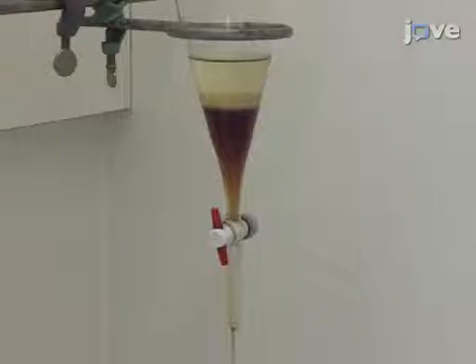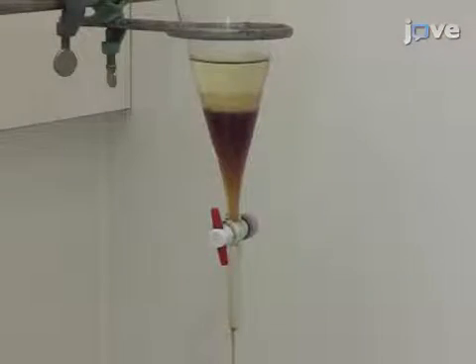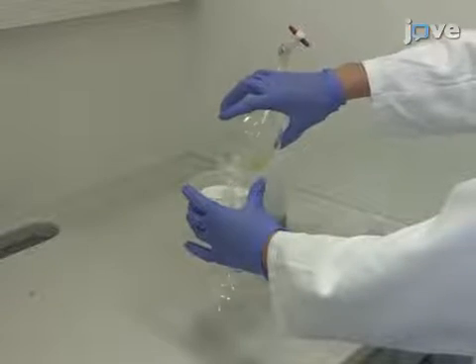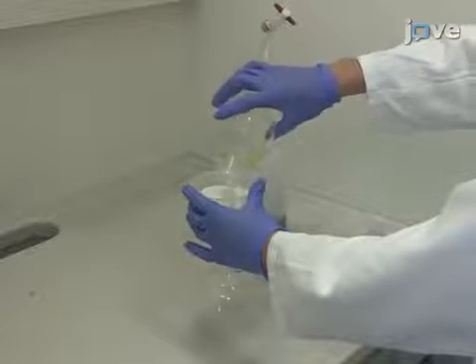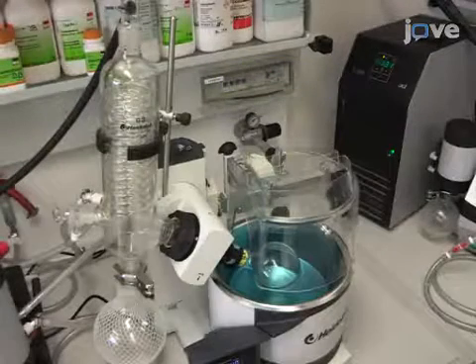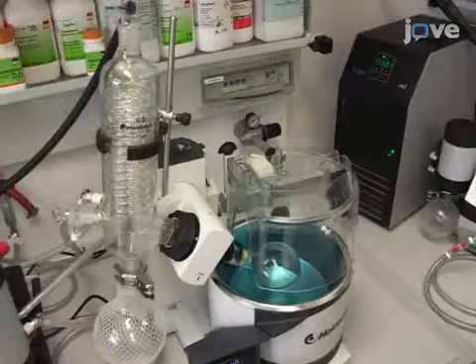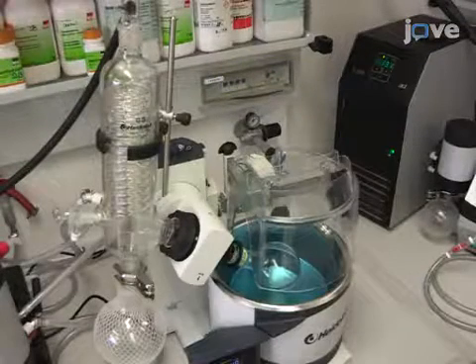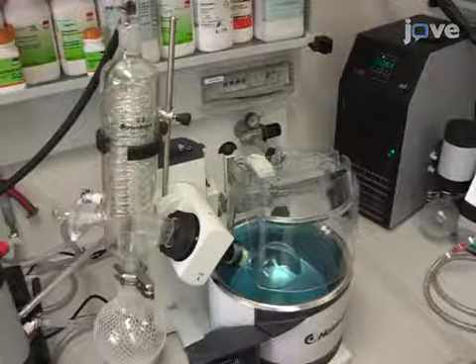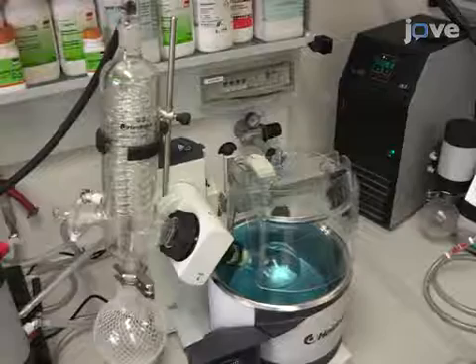Next, collect the ethyl acetate phase and transfer it into a round bottom flask through a filter paper. Evaporate the ethyl acetate by rotary evaporation at 40 degrees Celsius and 240 mbar.